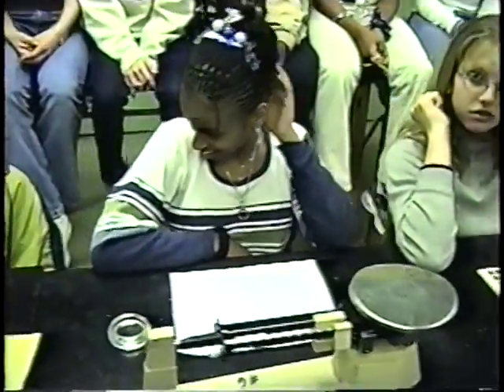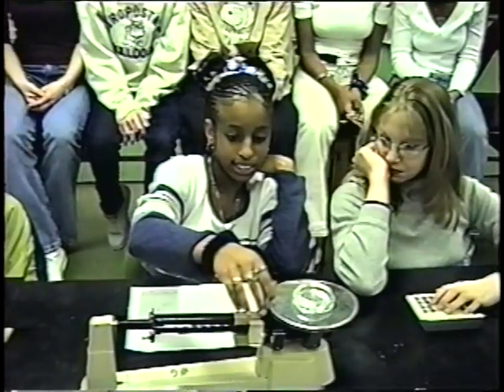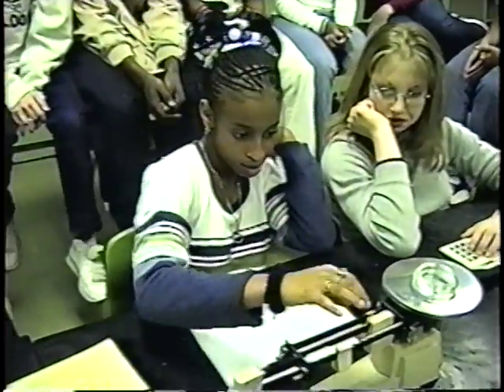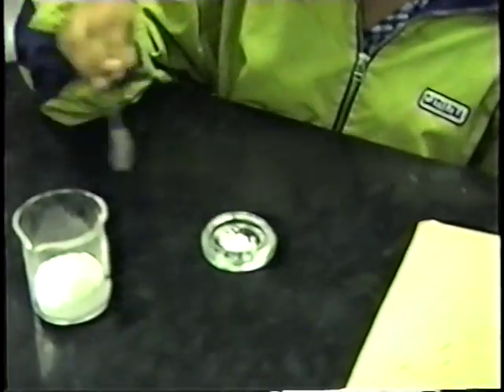And you, Aisha, have a watch glass. We want you to weigh up the watch glass for us. And what'd you get? 81.7. Okay, now pass your watch glass to Audrey. Audrey, put a spoonful of the chemical into the watch glass, and then pass it back to Aisha. Aisha, you're going to weigh it a second time for us now.